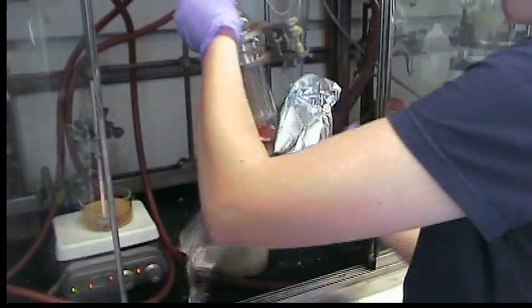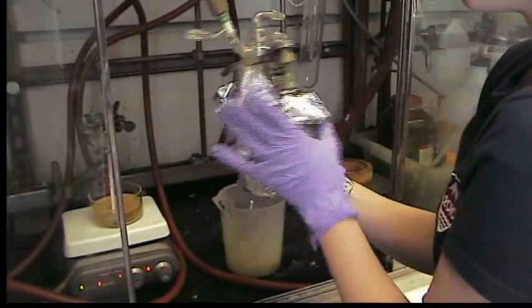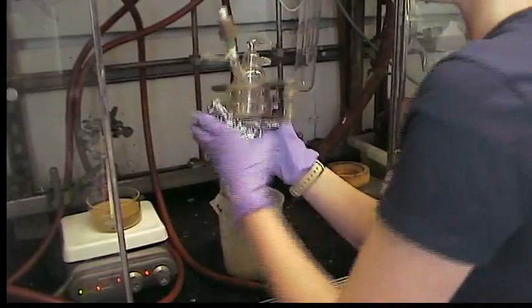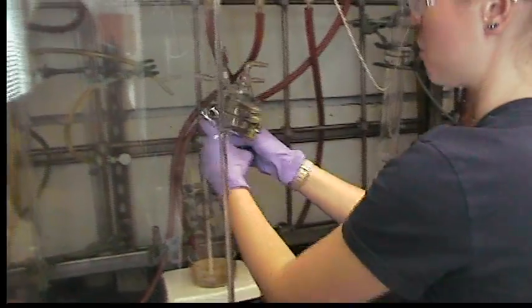I turned off the light. I'm going to turn off the light and then wrap your sublimator in aluminum foil, and we'll put a piece right over the top as well.